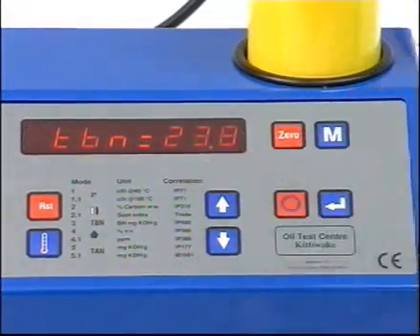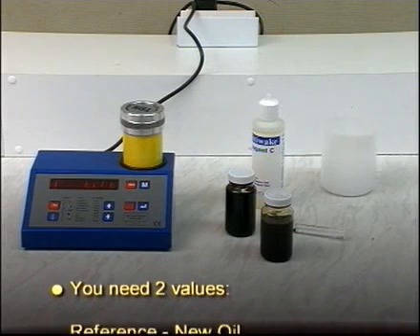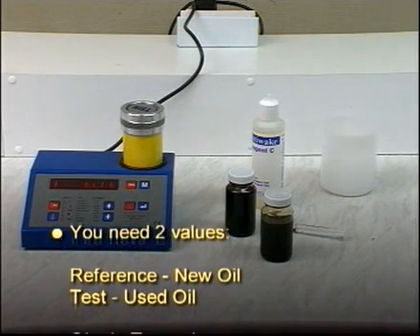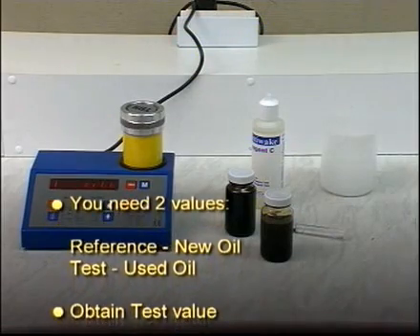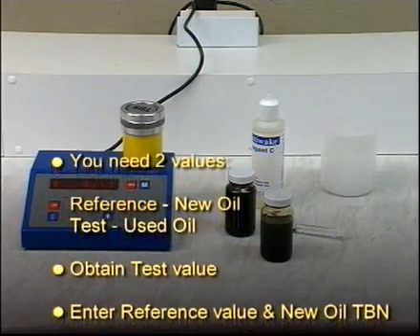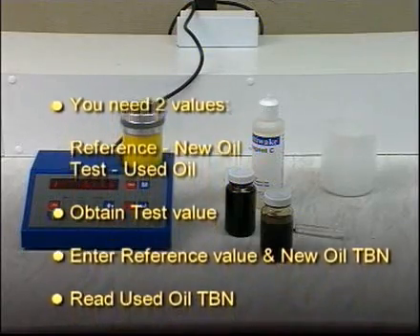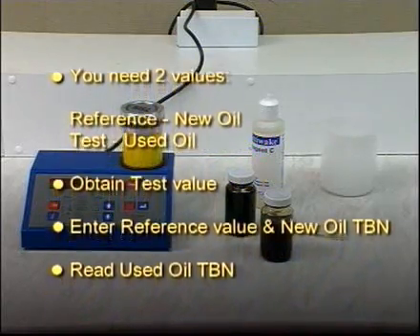To summarize, you need two values: the reference value from new oil and the test value from used oil. The used oil sample will provide the test value. Enter the reference value and new oil TBN, then read the used oil TBN.